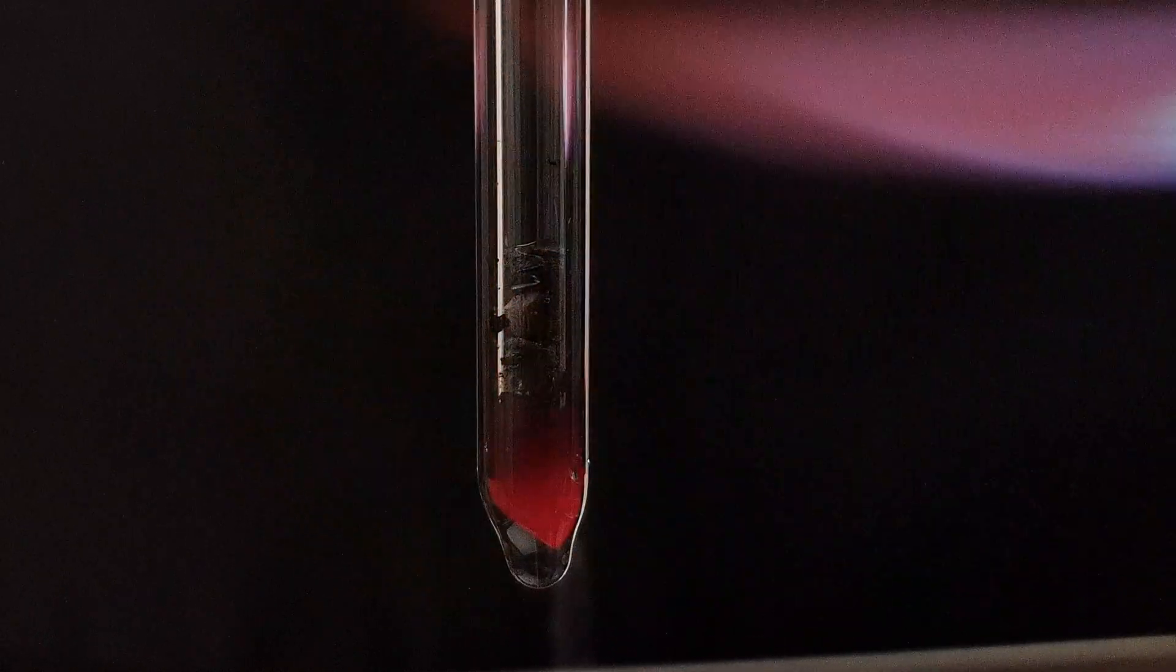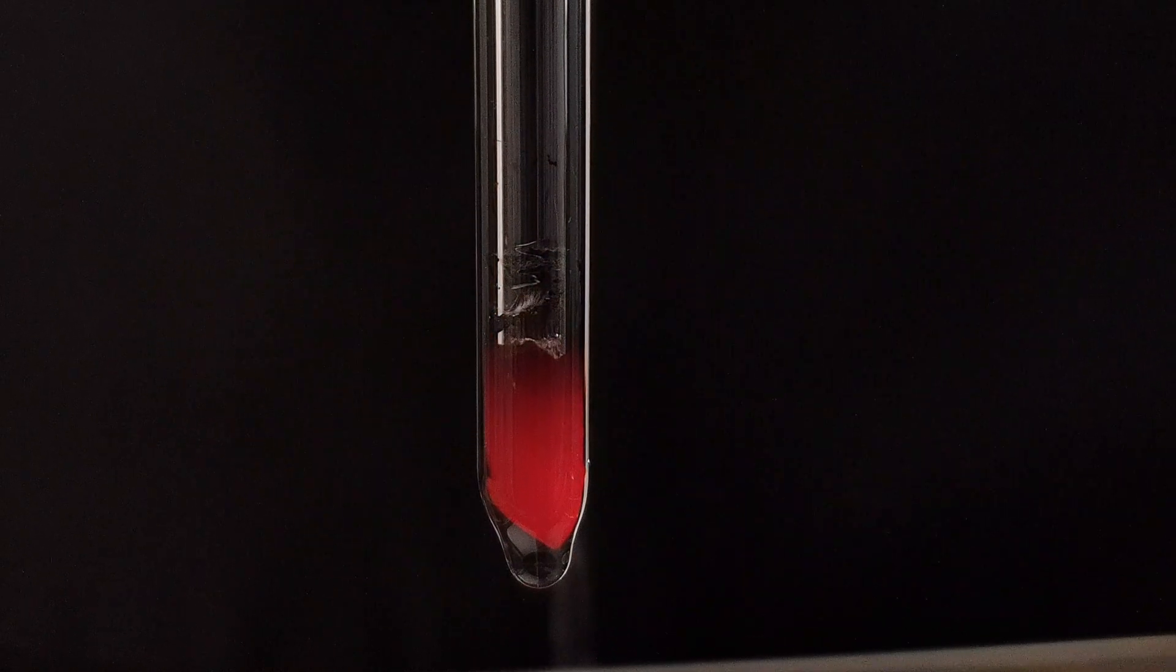Glassware under vacuum would certainly implode. Here you can see an example of the glass failing completely.